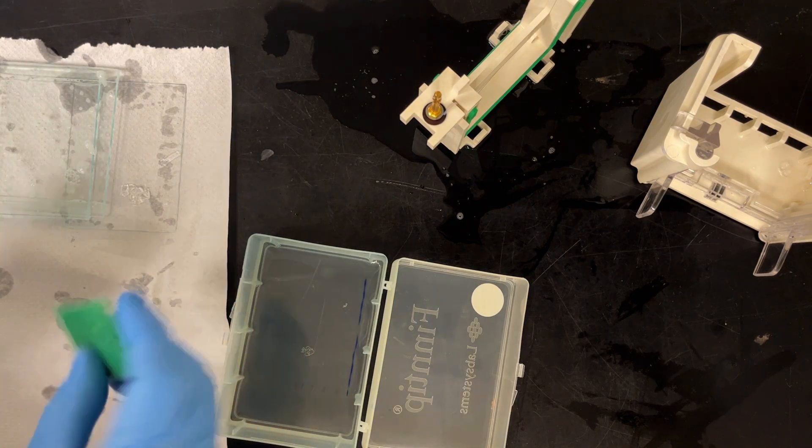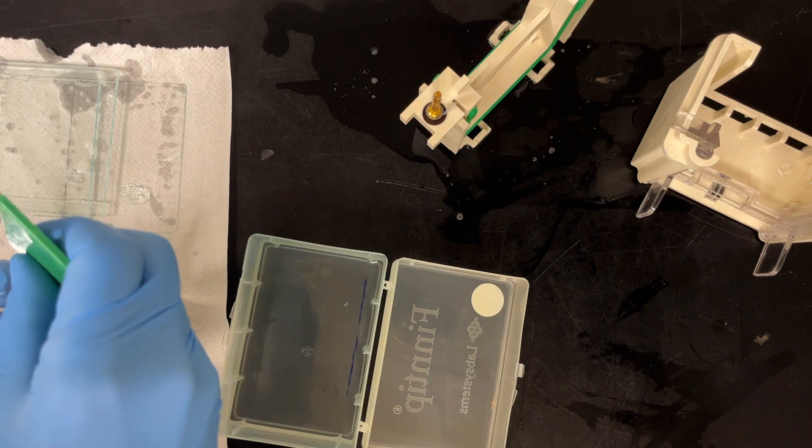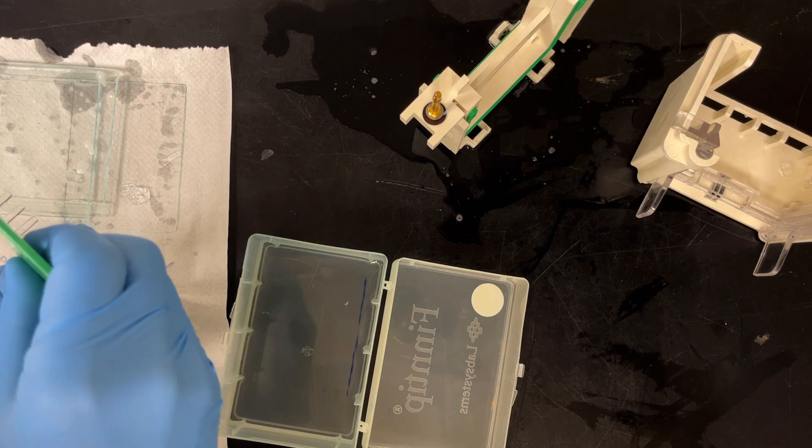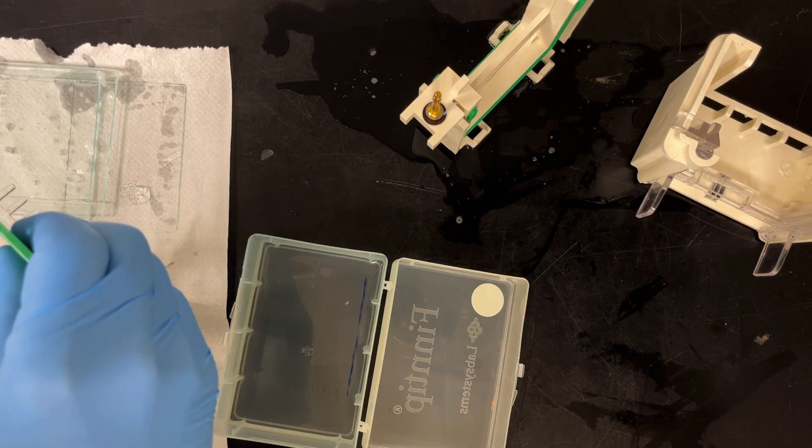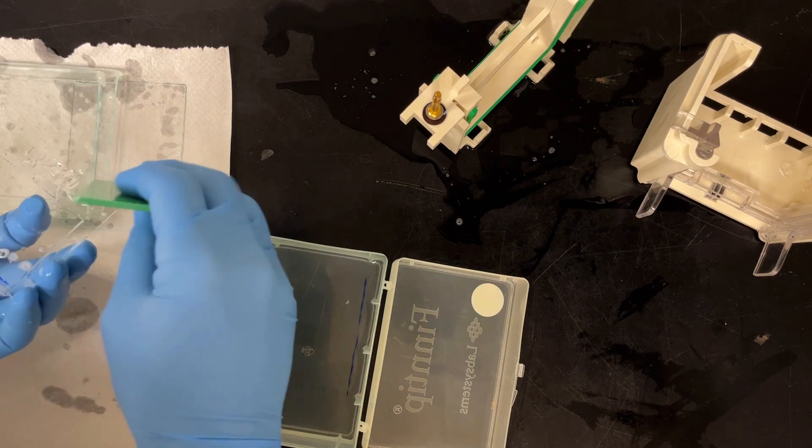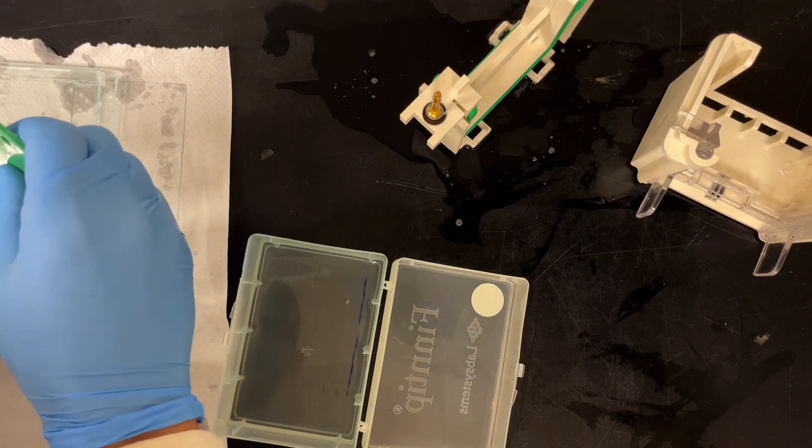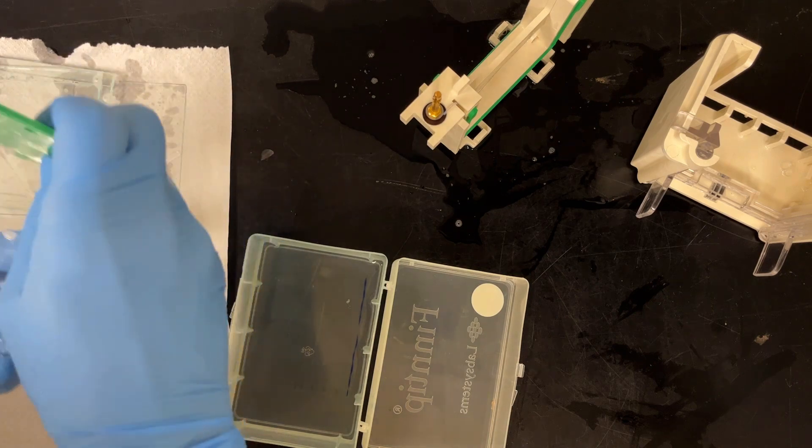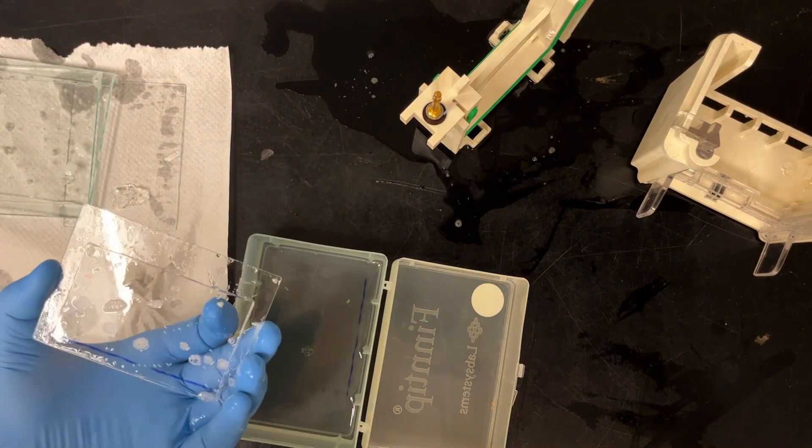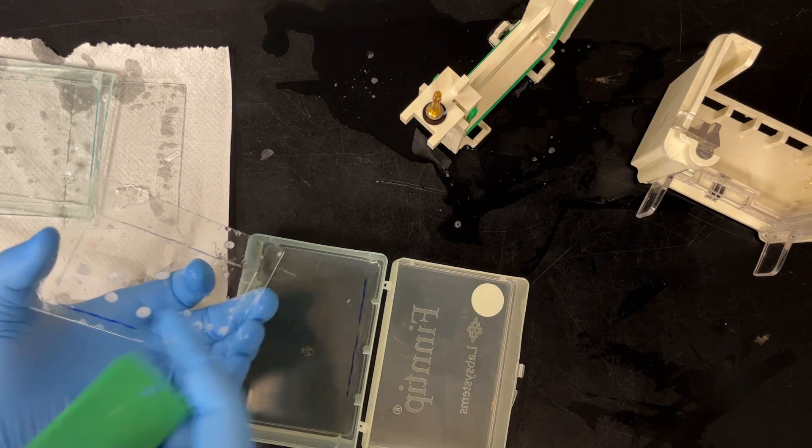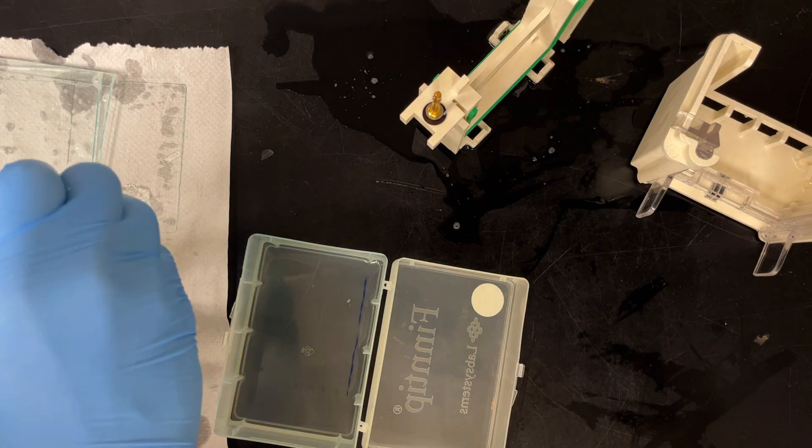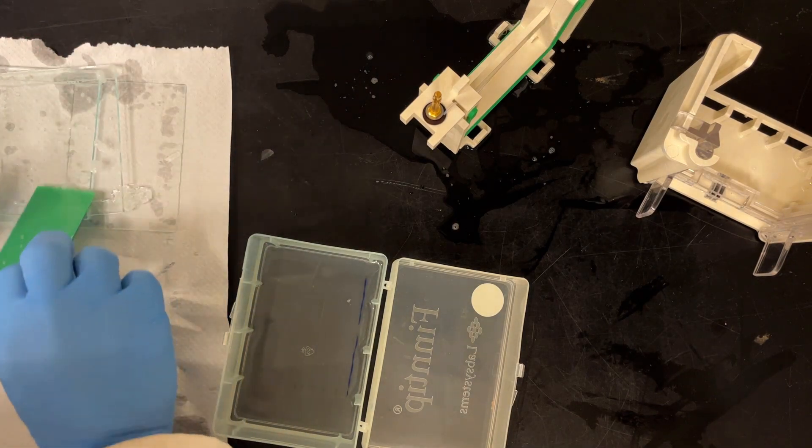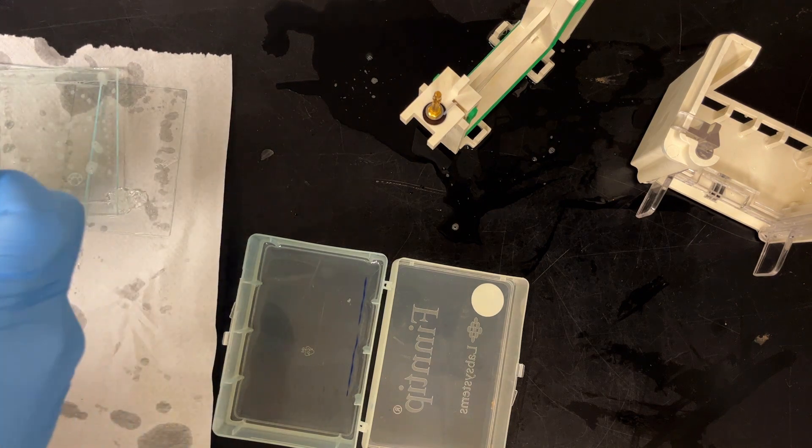In this case now, I'm off camera. But peel off the wells using your nice clean cutting tool, your gel separating tool. And then let's get back on camera. That's my lane one, so top left for lane one.